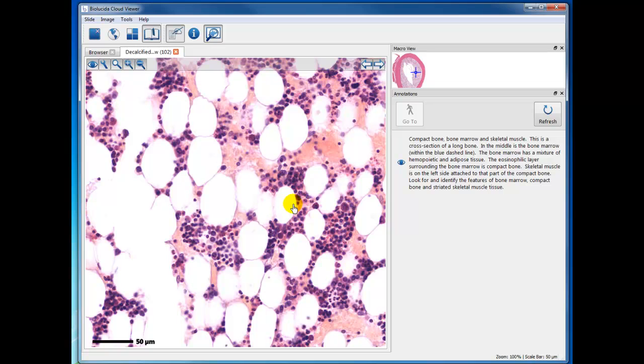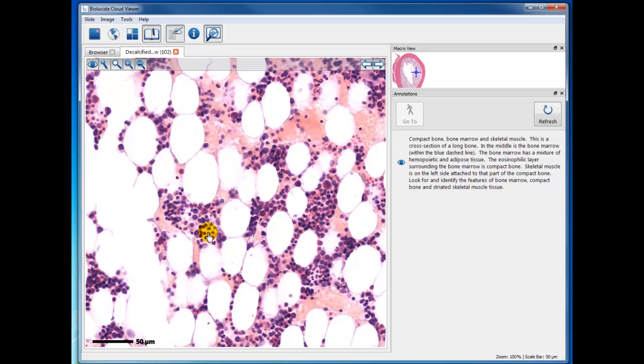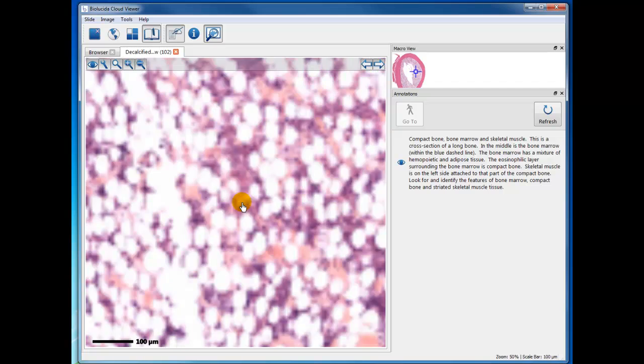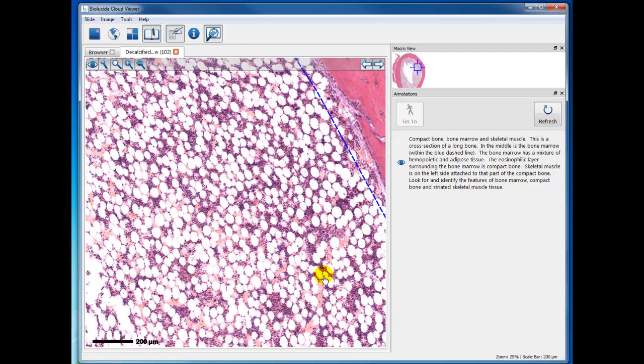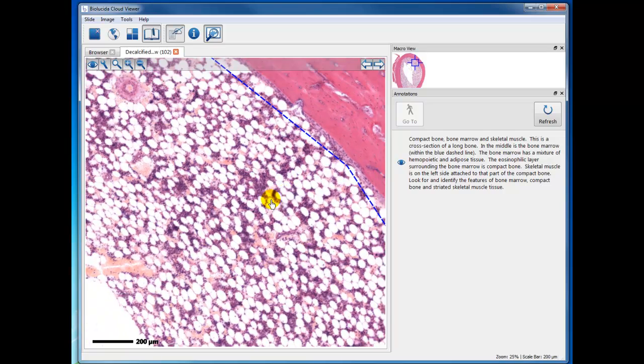And you see a combination of adipose tissue and hematopoietic tissue. Now, these somewhat reddish areas, very light reddish, those are collections of red blood cells that were not fixed very well, so you can't see the individual cells. Many of the small rounded nuclei could be either immature red blood cells or lymphocytes, and occasionally you may see a very large cell, like maybe this one and others, but you can look around in here and try to find megakaryocytes. I'll pause this, but this is not the best specimen to study and look at all the bone marrow cells.